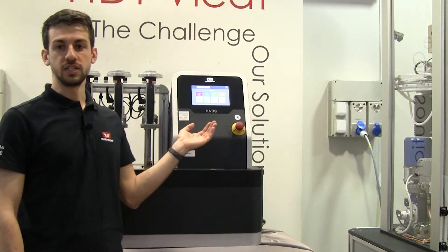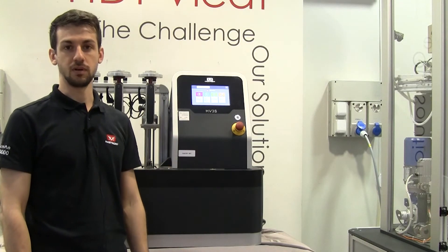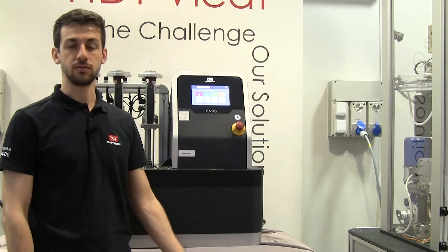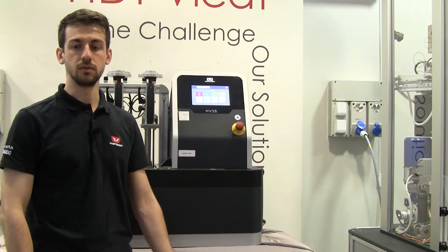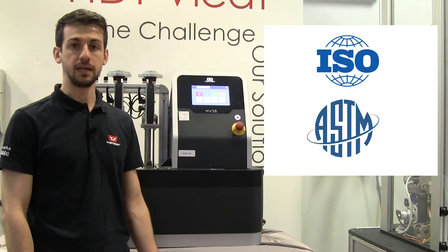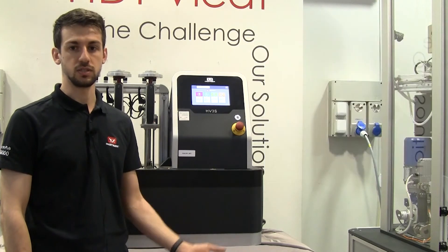The touchscreen display guides me through the entire testing process with step-by-step instructions. This ensures that the tests are error-free, simple, and repeatable. The predefined ISO and ASTM templates enable me to run tests in just a few simple touches.